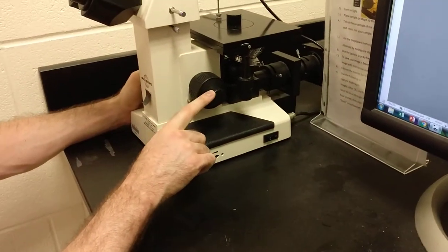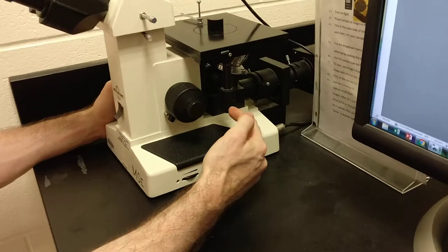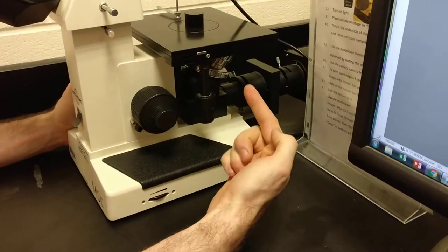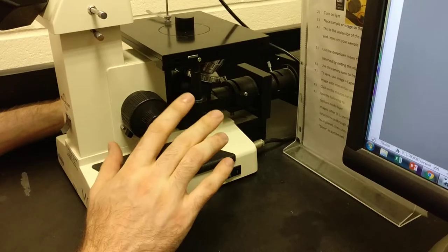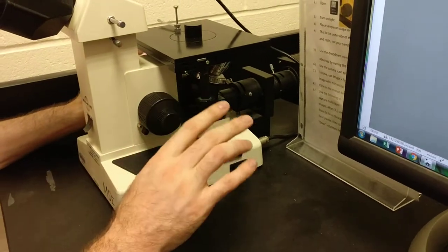A coarse and fine focus, stage movement left and right and up and down. We have a turret underneath which has all our objective lenses. On this one we have 50x, 100x, 200x, and 400x.